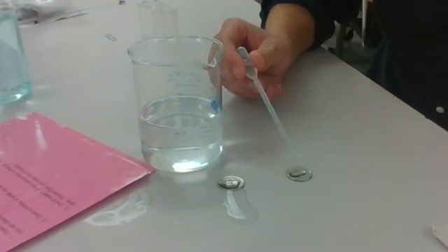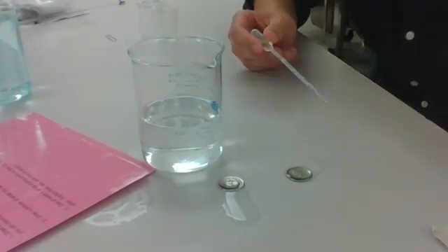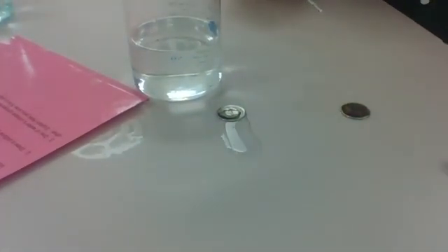1, 2, 3, 4, 5, 6, 7, 8, 9, 10, 11, 12, 13, 14, 15, 16, 17, 18, 19, 20, 21, 22, 23, 24, 25, 26, 27, 28, 29. Oh, I almost got to 30, but we did see that the cohesion was not as strong as water.